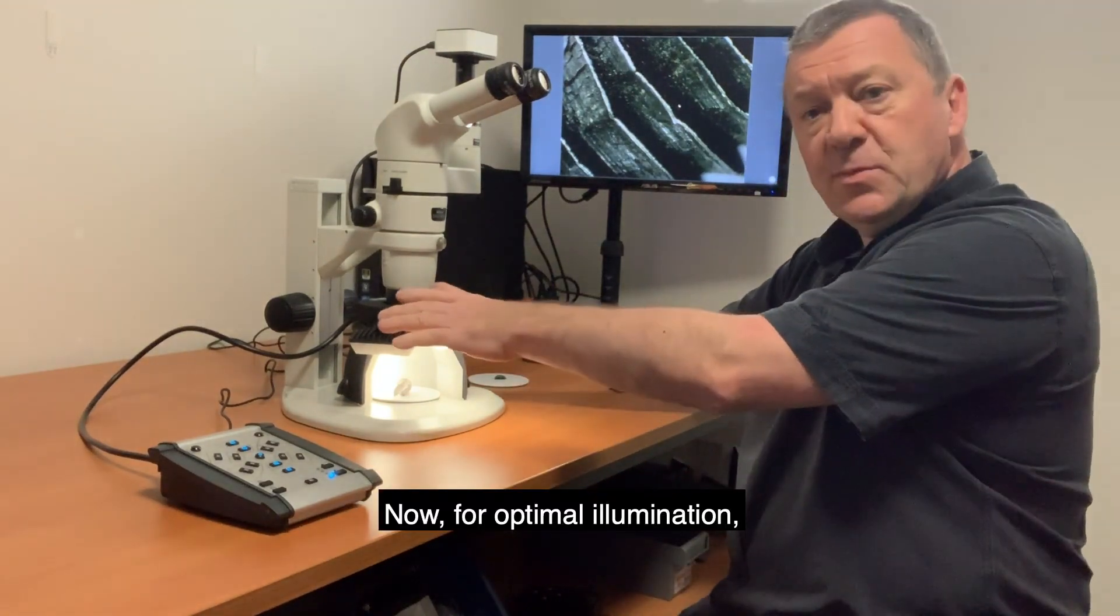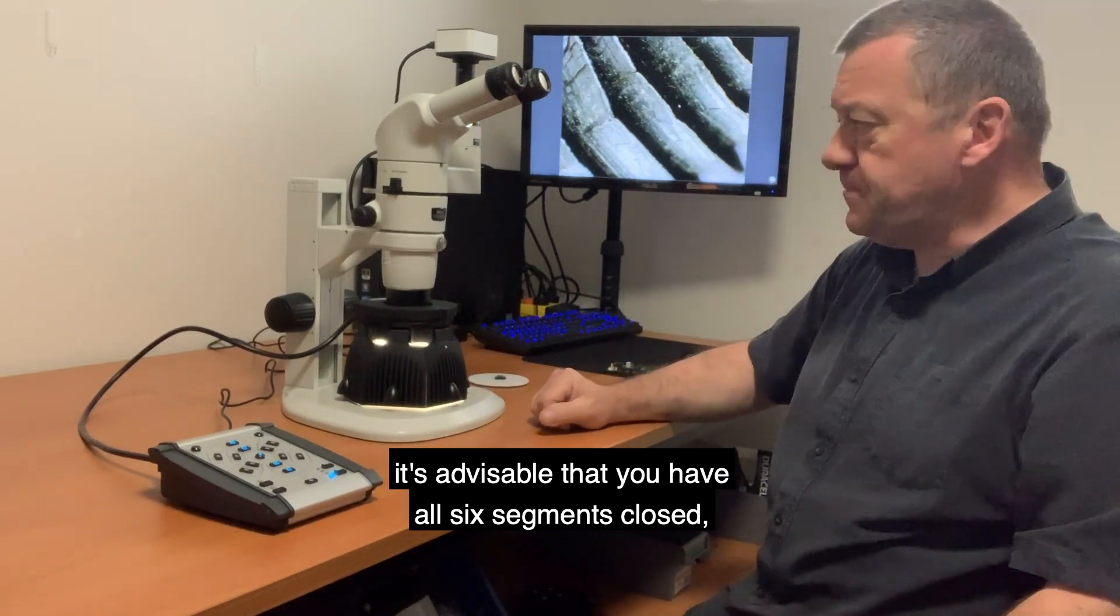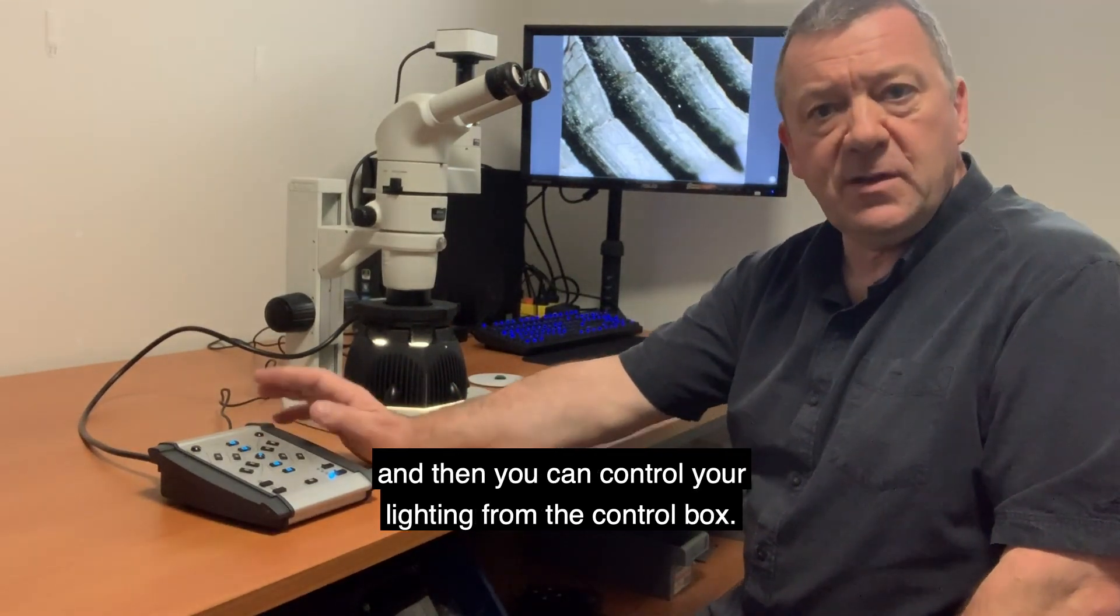For optimal illumination, it's advisable that you have all six segments closed, and then you can control your lighting from the control box.